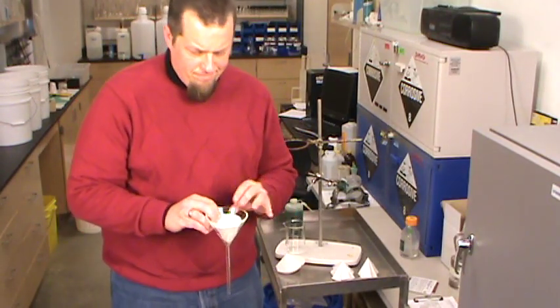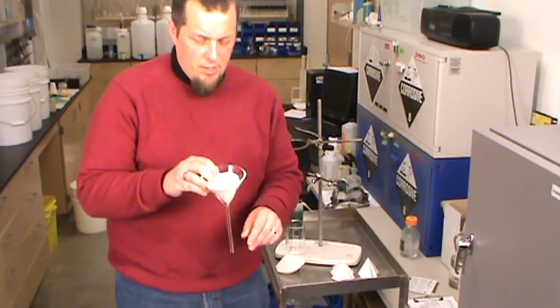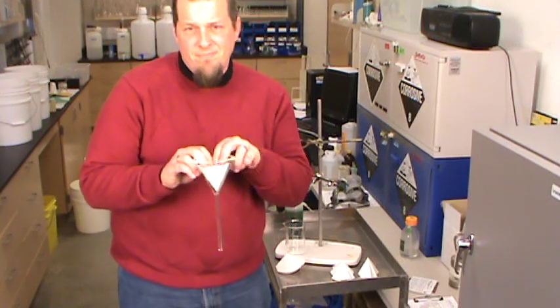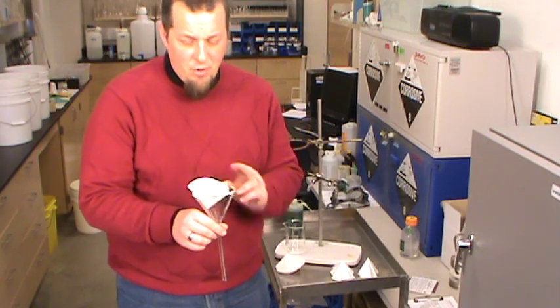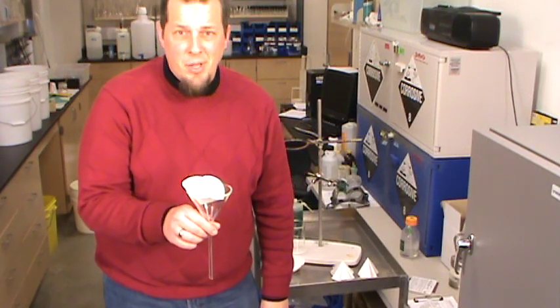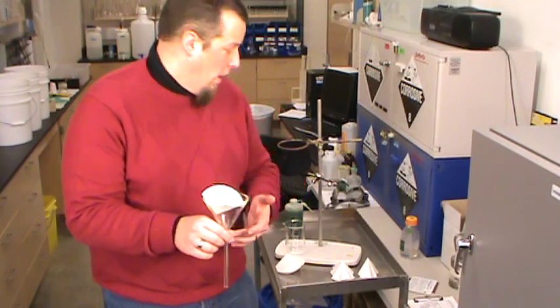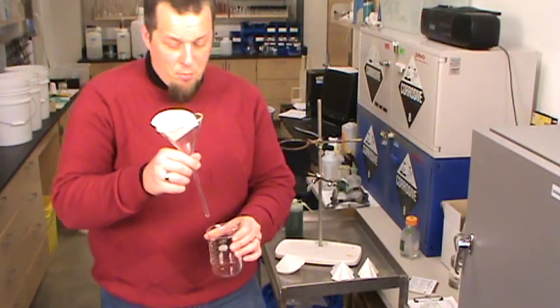How do I keep this from tipping over? Well depending on what you're doing and how much time you have, you could just hold it. But some of these filtrations can take a while.